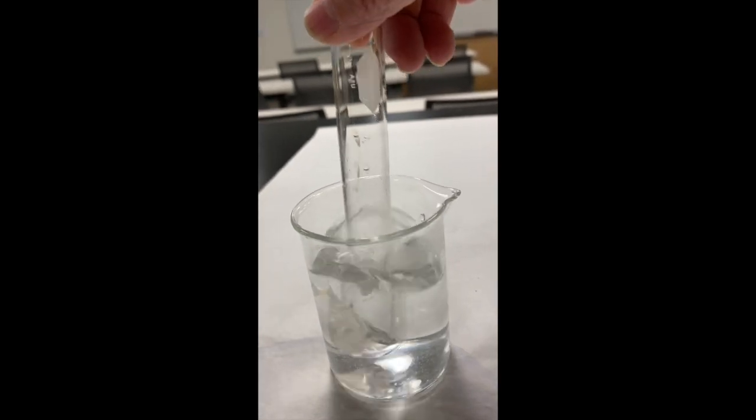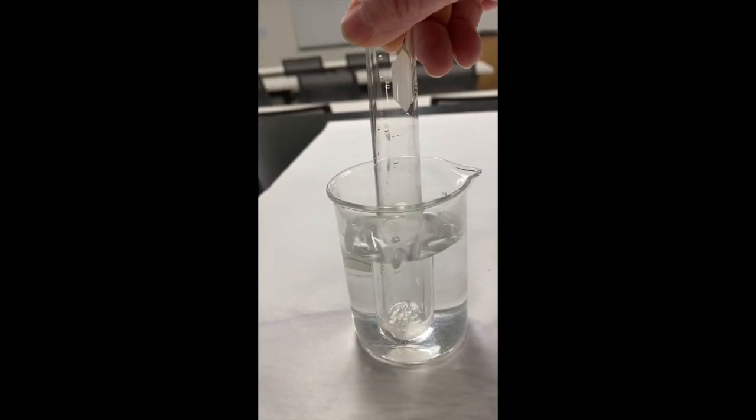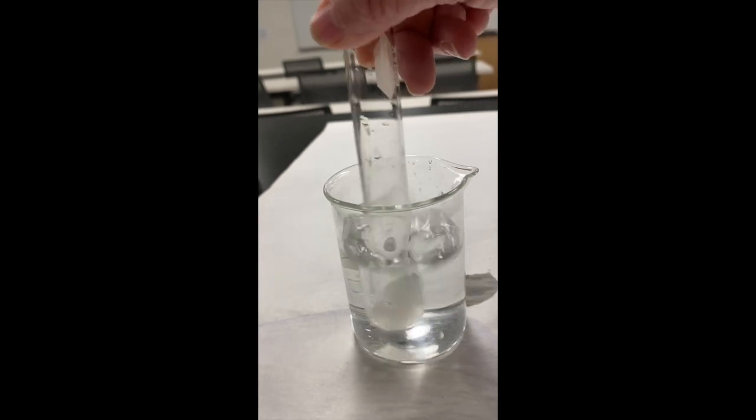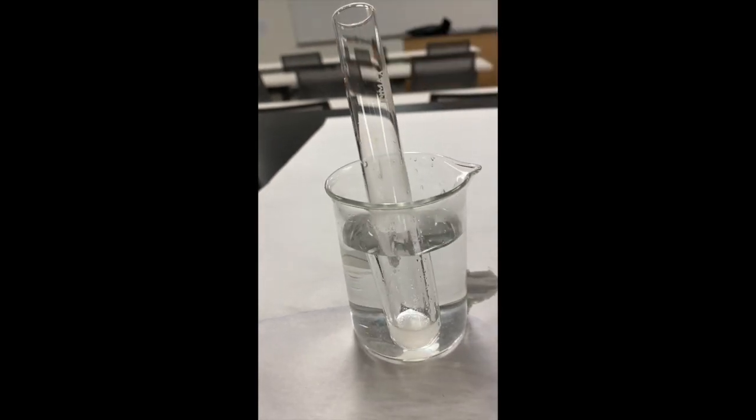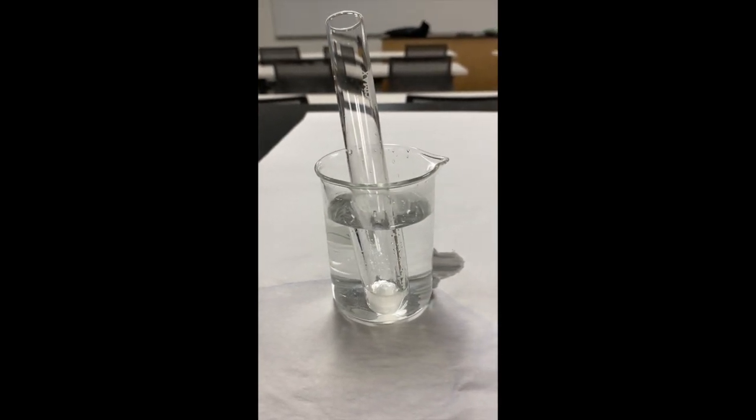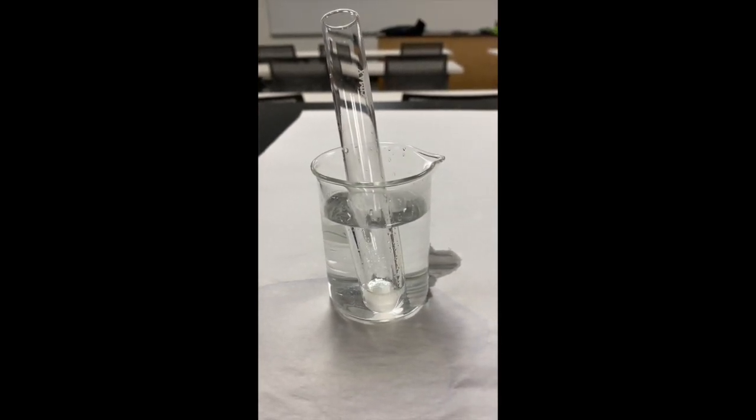So I'm going to put this one in some warm water. And if we put it in warm water, we're going to see if it's going to help it to actually react. So I'm going to put it in some warm water here. I'm going to let it sit for a couple minutes and I'll come back and we'll see if it does react or not.